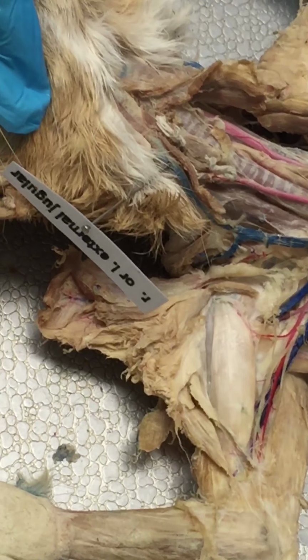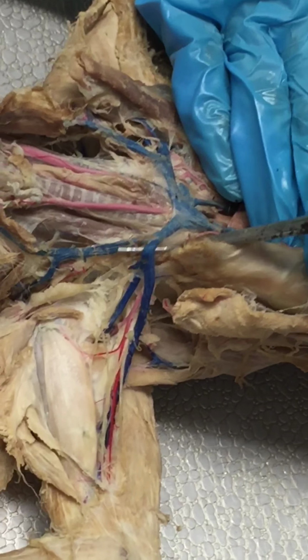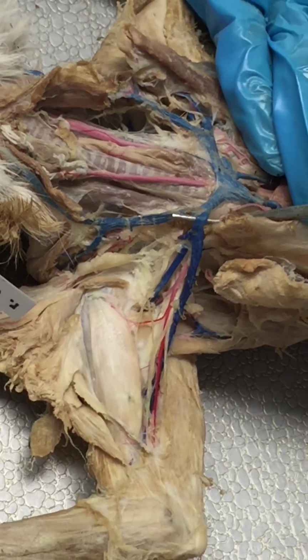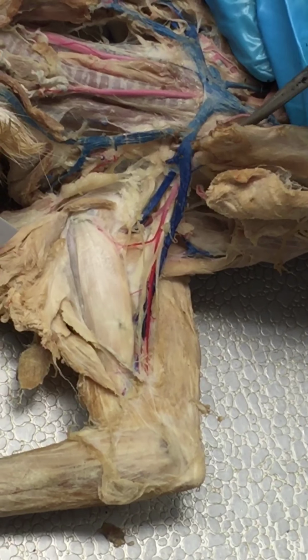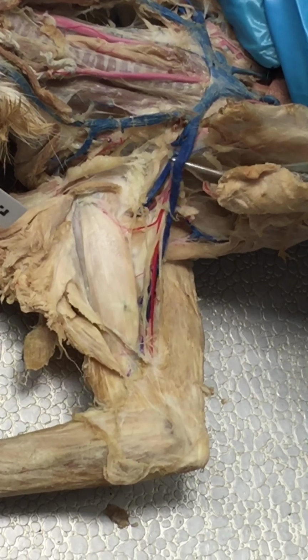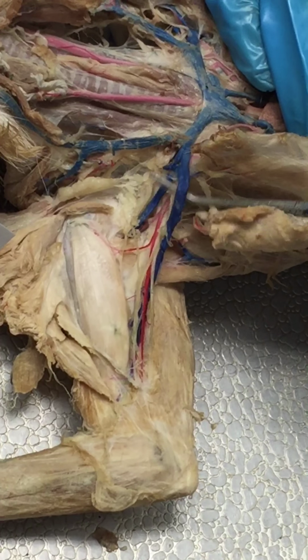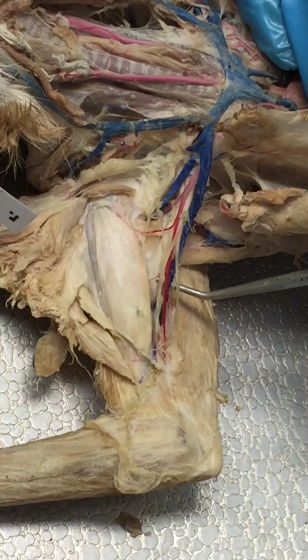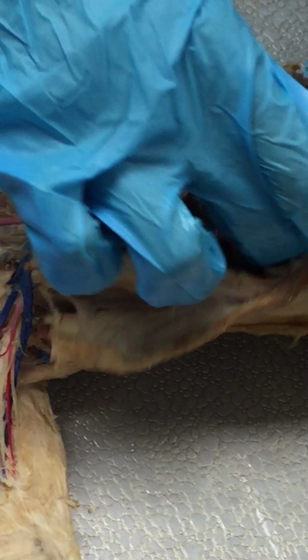Okay? Cool? Cool. Okay. And same thing for your subclavian as for arteries. Your right subclavian, or any left subclavian as well, would be inside that rib cage. As soon as it's outside the rib cage, it becomes your axillary, sits in that armpit, right axillary vein, and then right brachial vein. Cool? Cool. Okay.